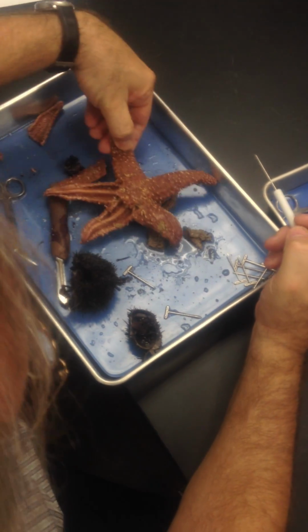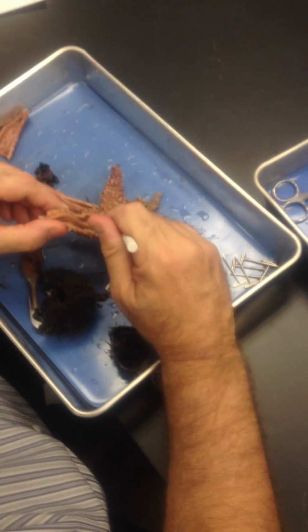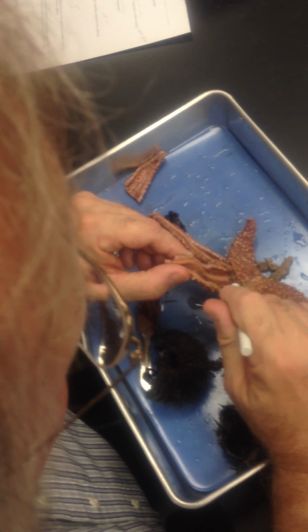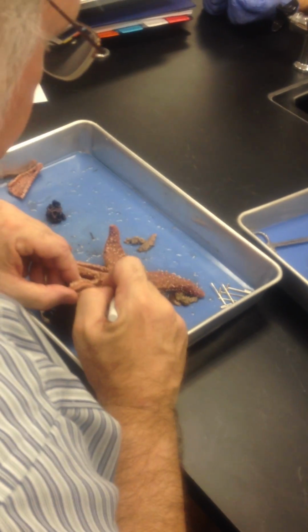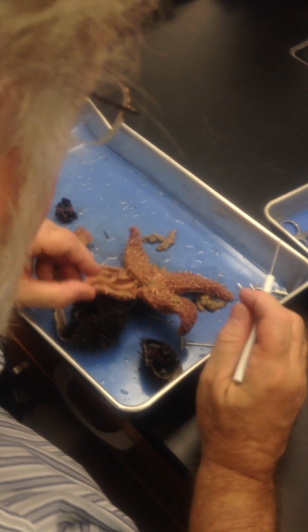I think that's reasonable. Gonads, this is not reproductive time, so the gonads have greatly shrunk, and so right there, do you see that? Hardly worth even showing. Gonads right there, gonads right here. Now, if I actually had a starfish and it was reproductive time, we could show you that much more abundantly, but very high and close to the central disc.